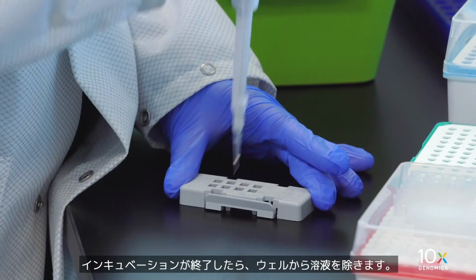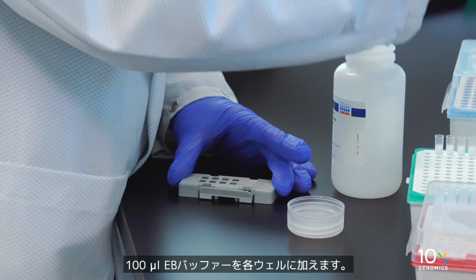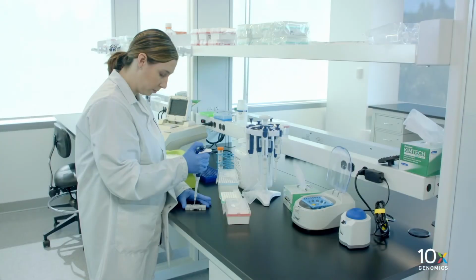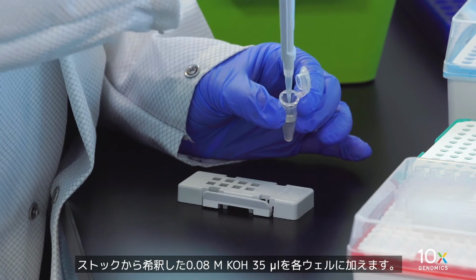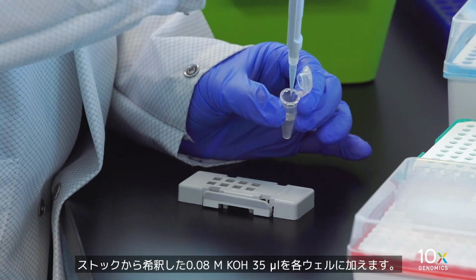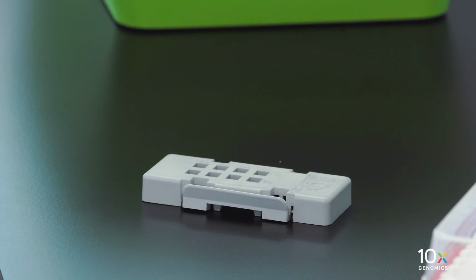At the end of incubation, remove reagents from the wells. Add 100 microliters buffer EB to each well. Remove buffer EB from the wells. Add 35 microliters 0.08 molar KOH diluted from stock to each well. Ensure even coverage. Incubate 10 minutes at room temperature.